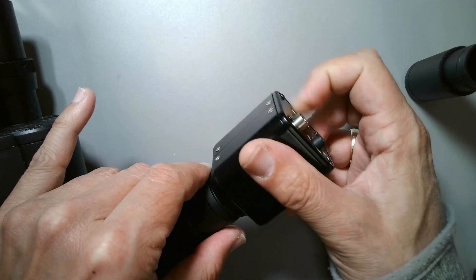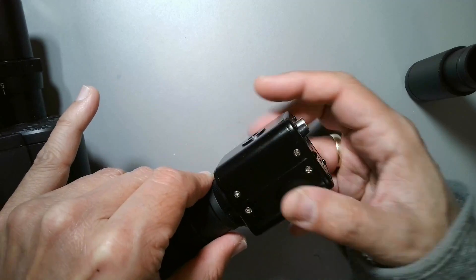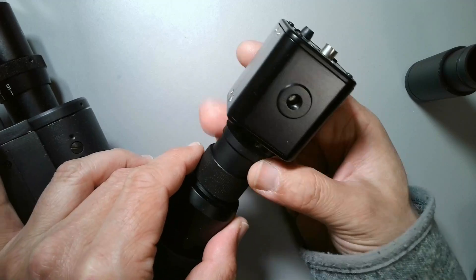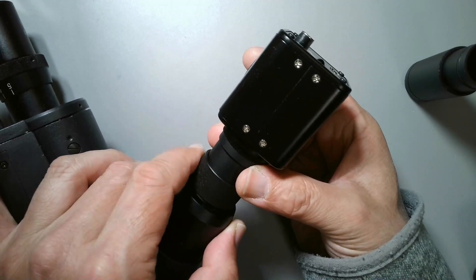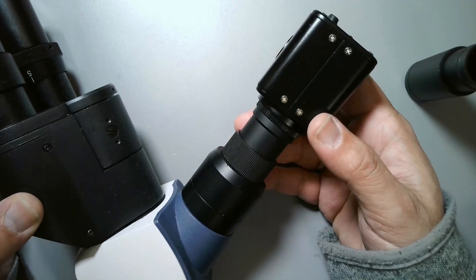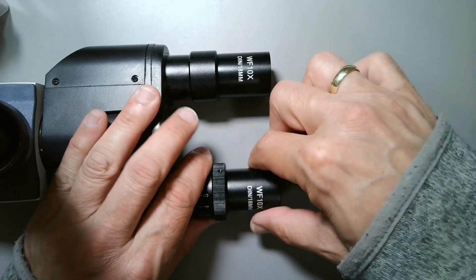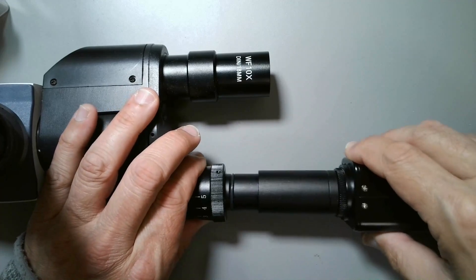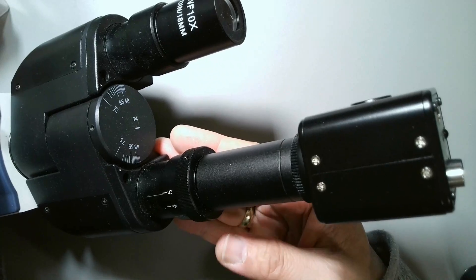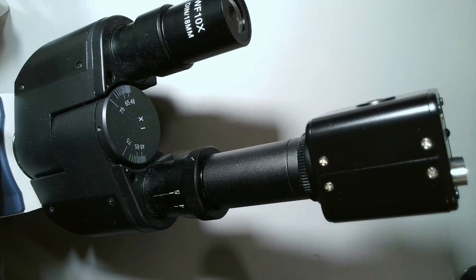What's the advantage of connecting directly? The whole system becomes more compact and a little bit cheaper since you don't need reduction optics. The disadvantage is it results in significantly larger magnification because the image is projected directly onto the sensor, and you have to adjust the distance to get a focused image. I do not always recommend this — the field of view is not very large, you get empty magnification, and the image looks quite different compared to what you see through the eyepieces. Also make sure the microscope is sufficiently steady so it won't tip over.